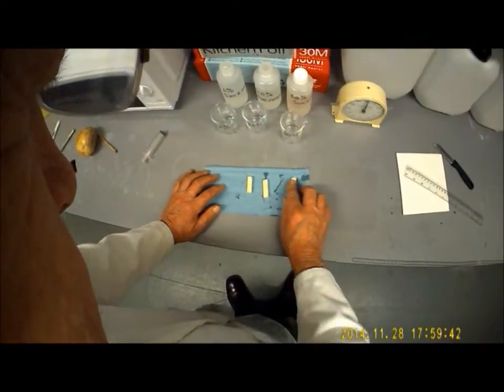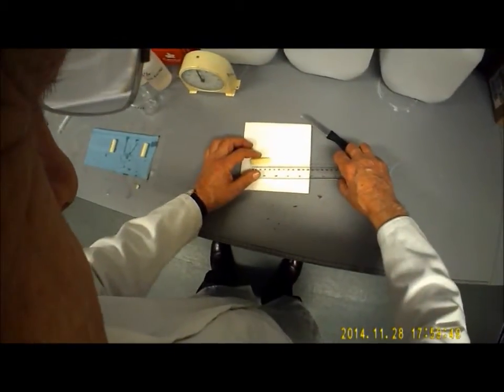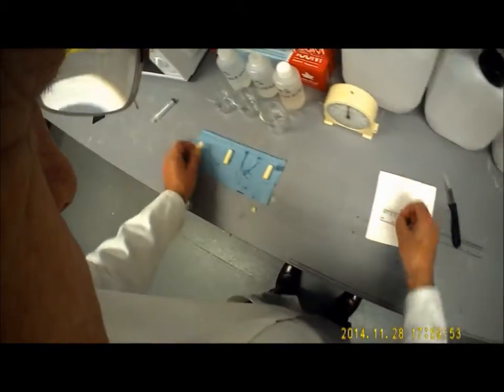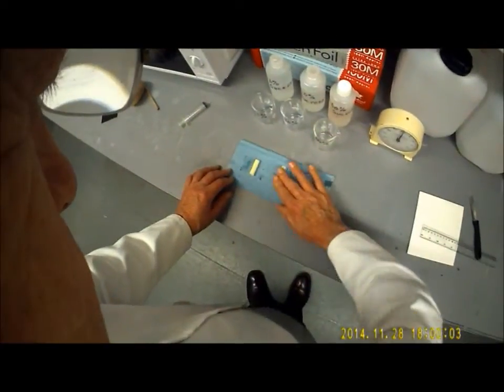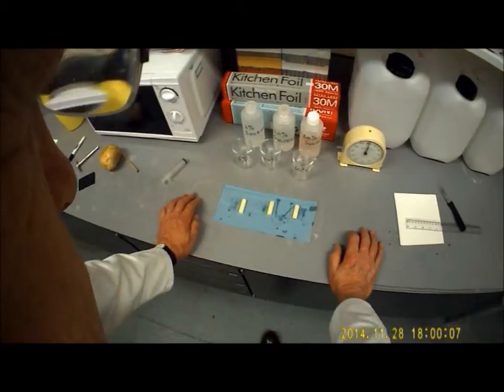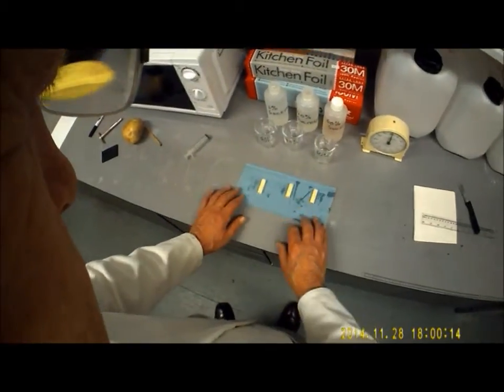What we're going to need to do is obtain a starting mass. That one looks totally different actually. Let's remeasure that. Just trim that off a little bit. It's better. So now we're going to measure the mass of all of these potato cores, and you're going to record it in a table which you're going to draw up at time 0. So this is the mass at time 0.